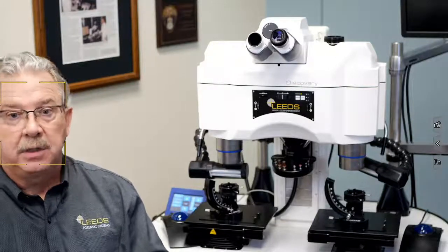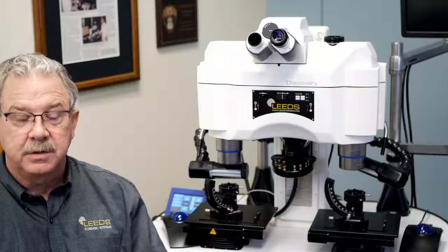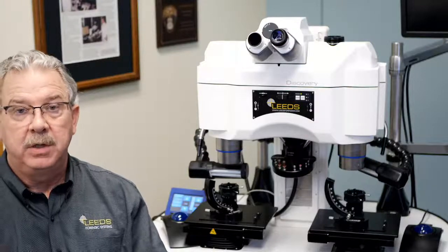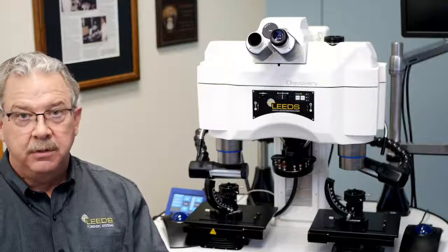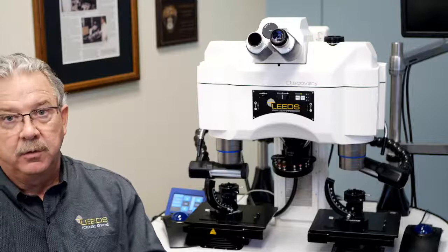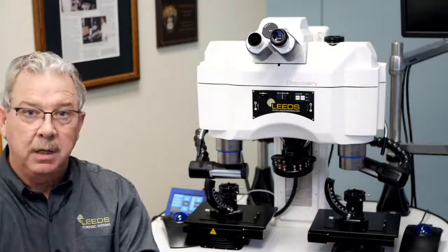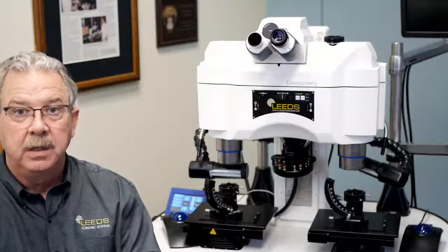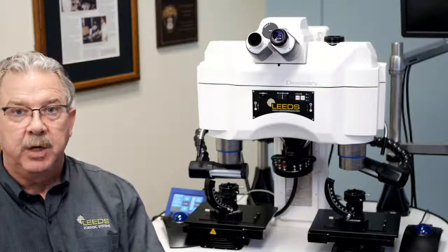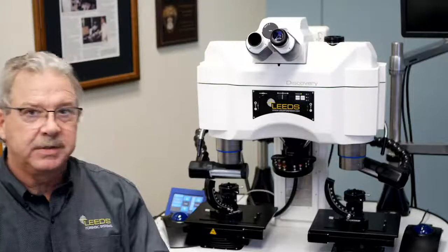So if you can imagine, if the edge of that field of view in our eyepiece determines a focal plane, which is what we just said, then if I want to image a ruler or some other type of grid pattern or whatever you might want on a reticle, then when I print that reticle, I want it to actually come into contact with that ring so that they're both in the same field plane. That'll put the real image of my microscope into the same plane as my reticle. Okay? Little bit of side note.